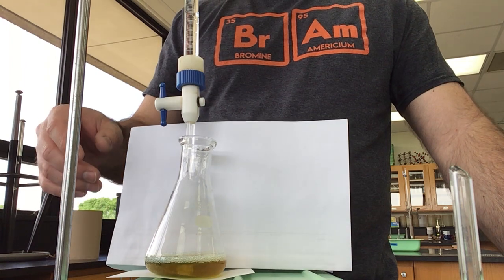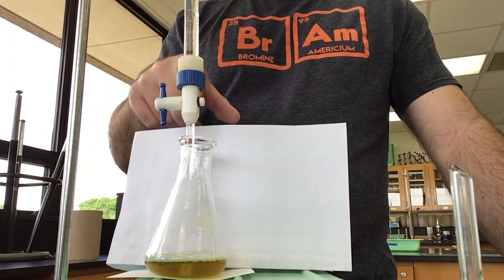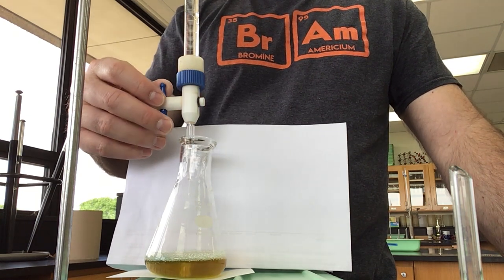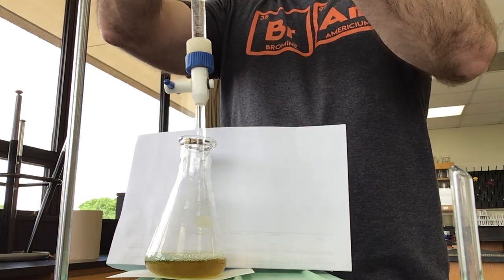All right, I've run a bunch of water through here so I feel really good that the tip is really clean. So I'm going to close the valve here and dump out the rest in the sink.